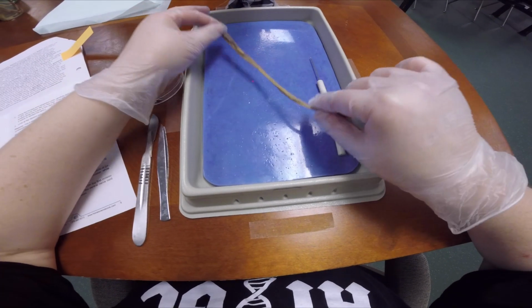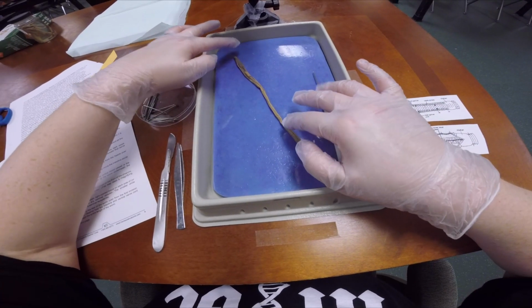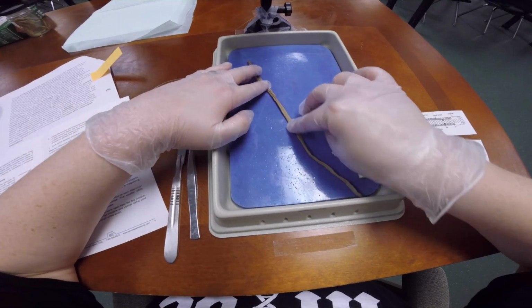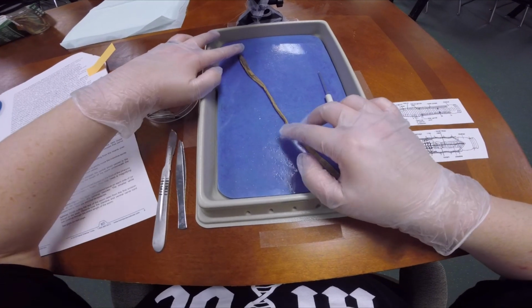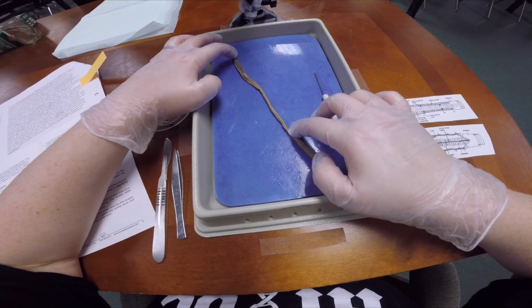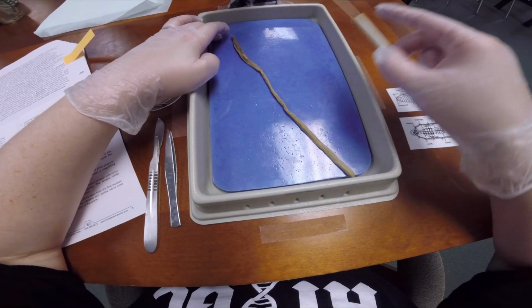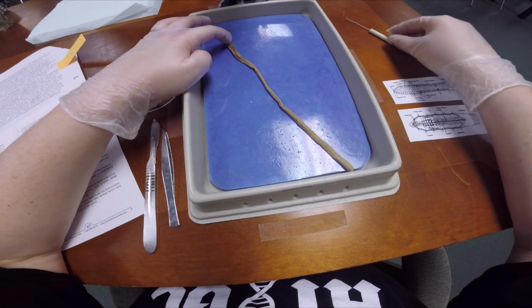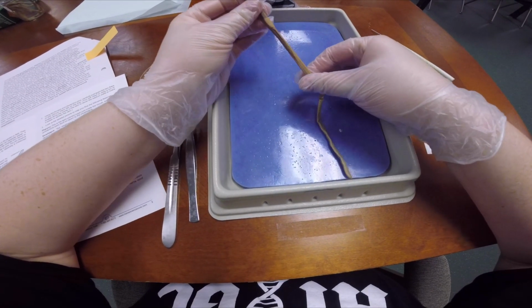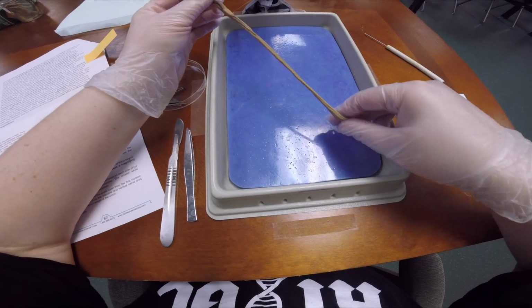If you place the earthworm right side up, now you'll notice that the top is more brown than the bottom, and you can think about why that's important. Earthworms are in the dirt, and if they don't blend in with the dirt, they will become dinner for something. You can see that the upper part is darker, and that'll help us line up our top versus our bottom when we try to pin this guy.